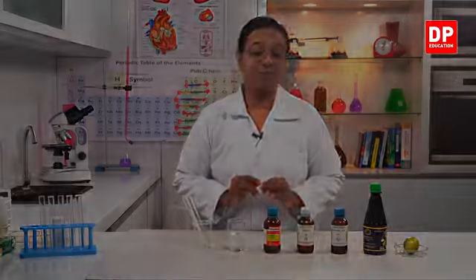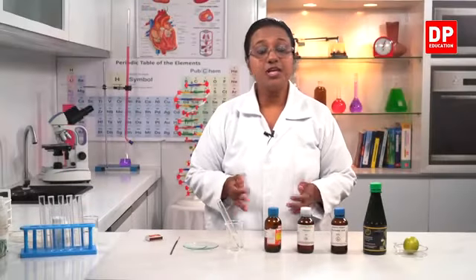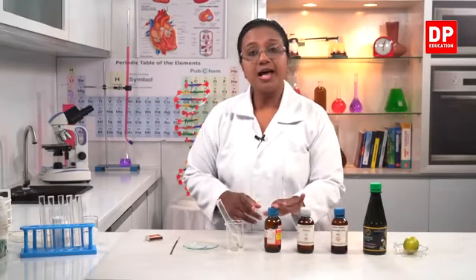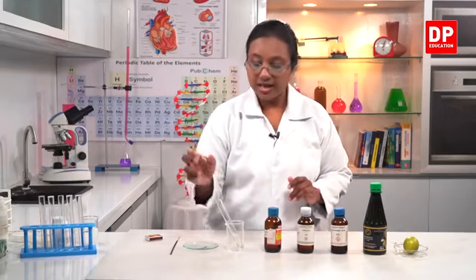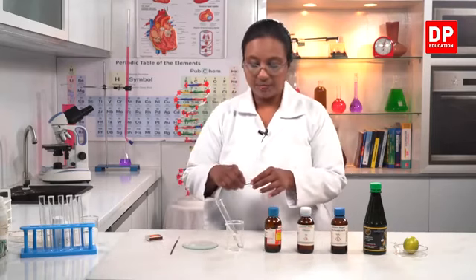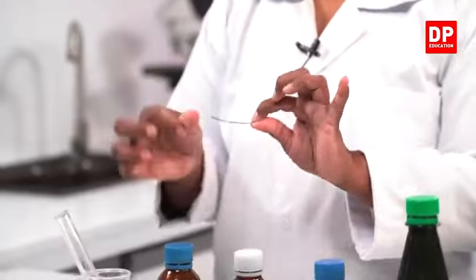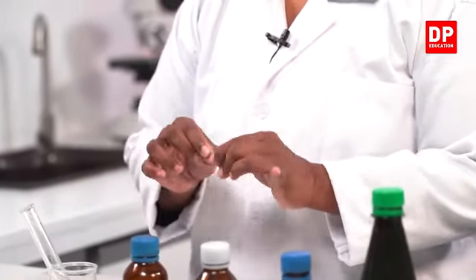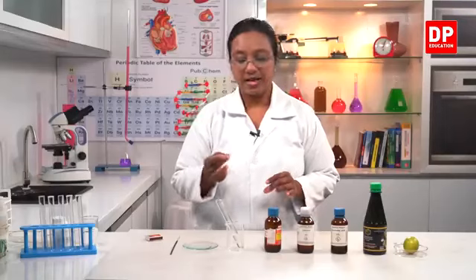That is very important. So acids react with metal to produce the salt and evolve hydrogen gas. So for example, I have hydrochloric acid here. So this is hydrochloric acid and this is the metal magnesium. So if we put a strip of magnesium, you all know normally the magnesium oxide forms. We have to clean it. Now this part is clean. You can clean it with the sandpaper. So I will break a small piece of the magnesium strip. It's a soft metal, so we can break it easily.